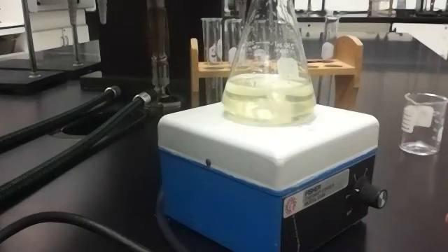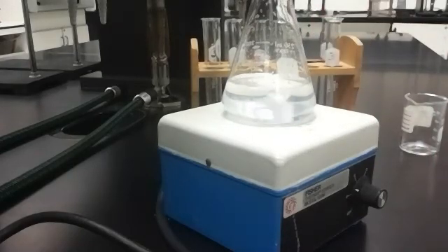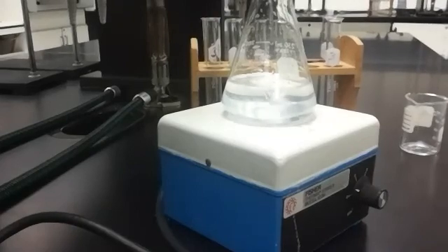Right now, I'm waiting for, there's my color change. So now I add another test tube. And we just wait, we started the timer over again. What that means is that at that point, there was enough iodine without a charge in the solution. Then I added that other test tube that took it back to iodide with the charge. So we're going back and forth.